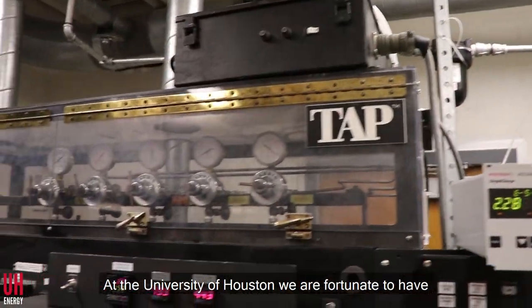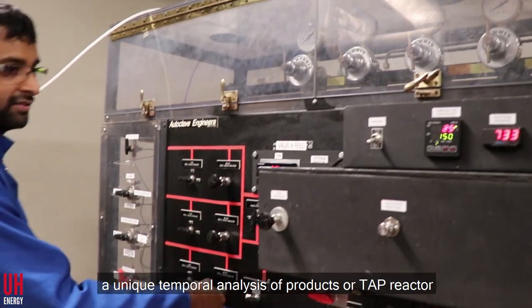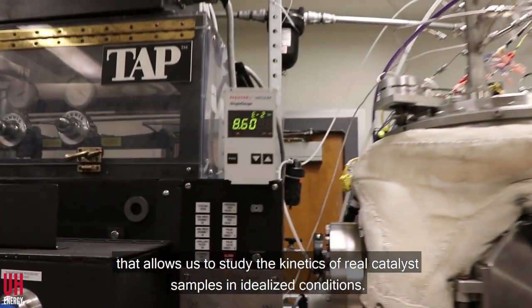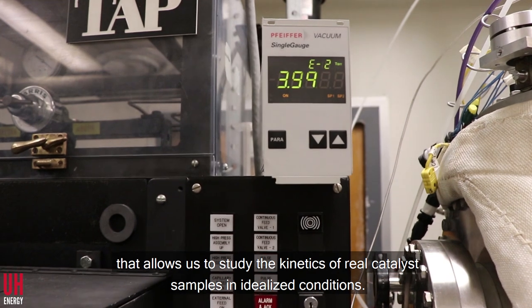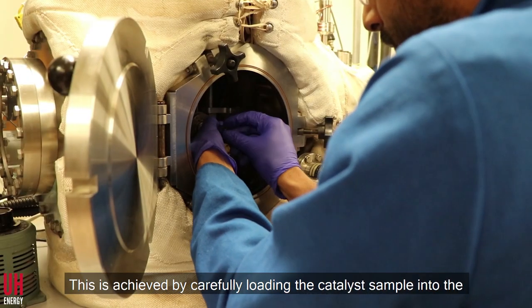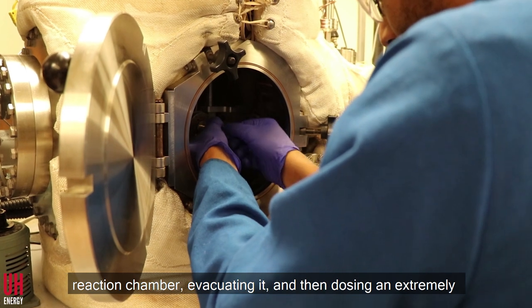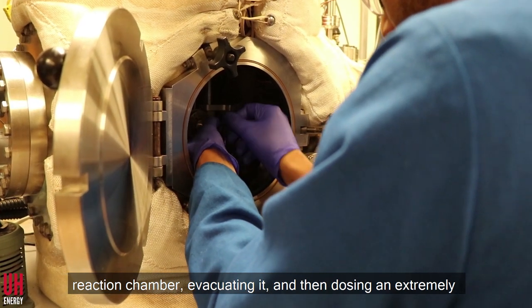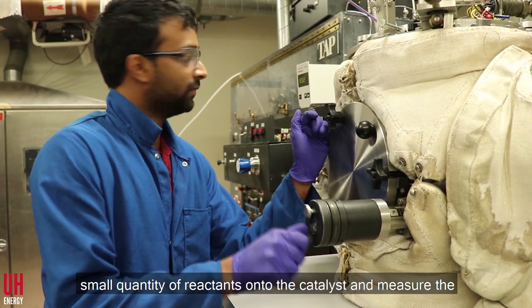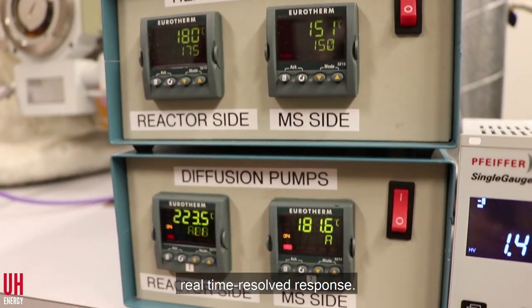At the University of Houston, we are fortunate to have a unique Temporal Analysis of Products, or TAP reactor, that allows us to study the kinetics of real catalyst samples in idealized conditions. This is achieved by carefully loading the catalyst sample into the reaction chamber, evacuating it, and then dosing an extremely small quantity of reactants onto the catalyst and measuring the real-time resolved response.